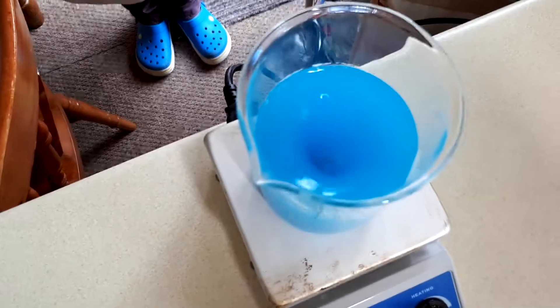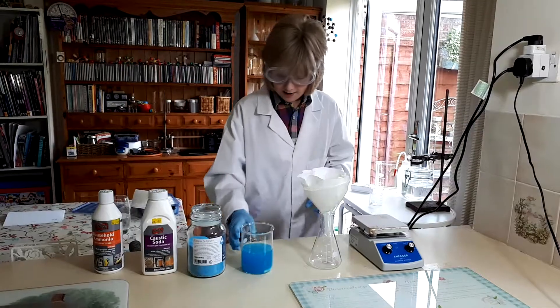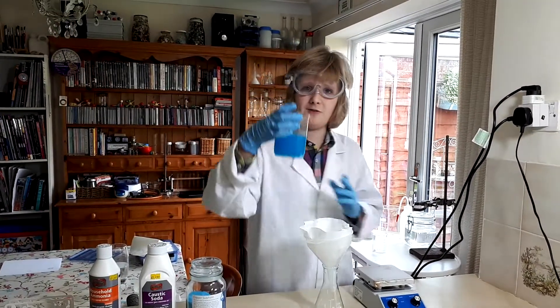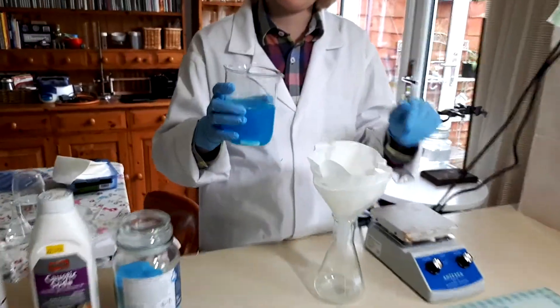This might take a bit of time. You might not be able to see it from here, but there are a load of impurities floating around. So what I'm going to do is just pass it through a coffee filter real quick.